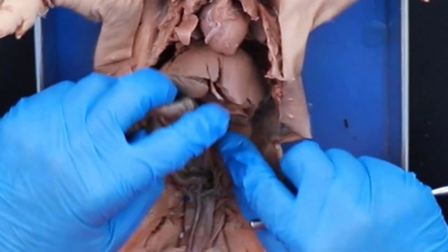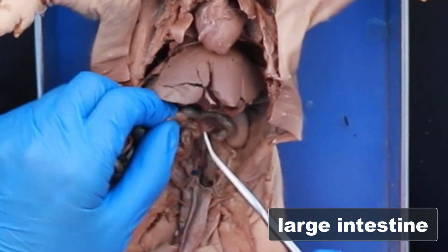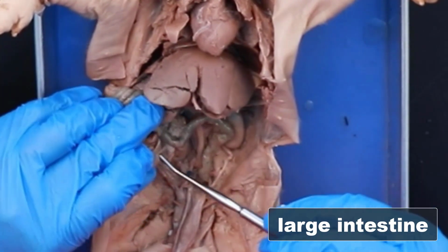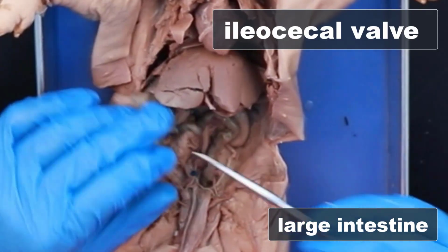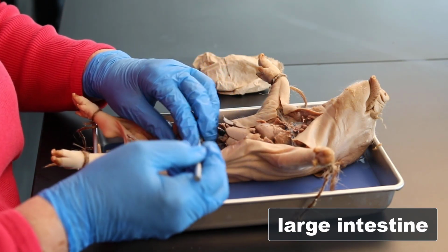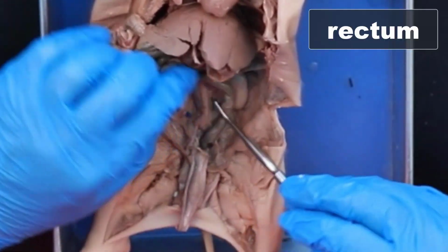And then we're going to get towards the large intestine, which you can see here. This is the easiest way to get it. Come up here, and you can see this changeover right here. All right, so this is large intestine. Here's small intestine coming in here. So this is the ileocecal valve. Cats and pigs and dogs don't have an appendix, so you don't go looking for one. All right, and so here's our large intestine going down into the rectum.